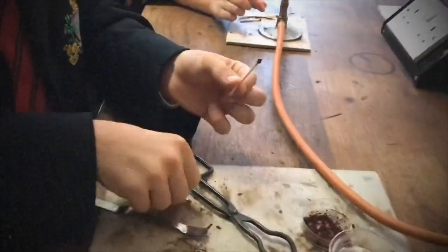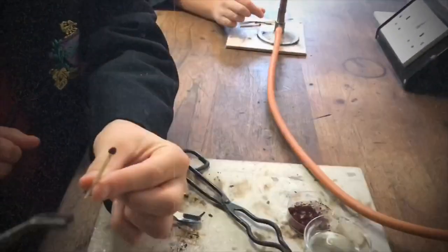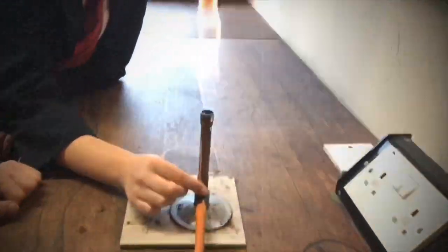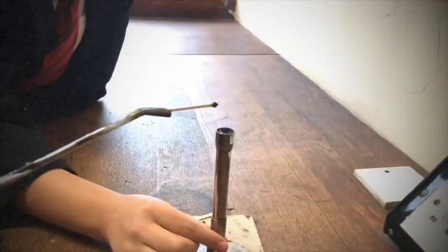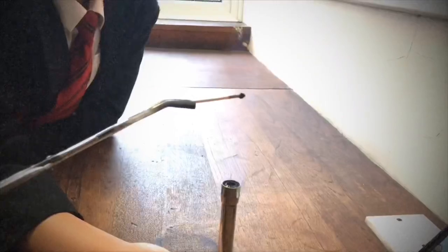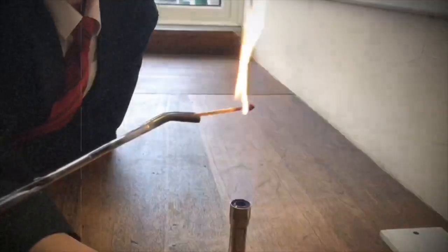So we get a nice coating on the top of the matchstick. Now using our tongs, we're going to be burning the match head, and as you can see, we put it onto the blue flame to give it some more heat.